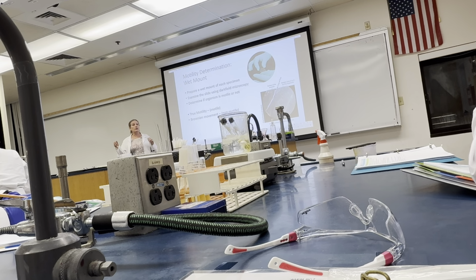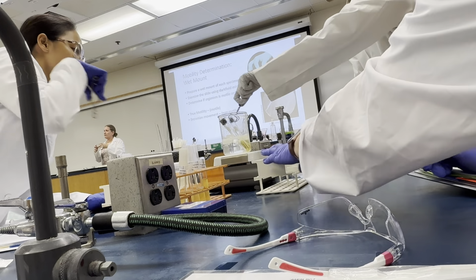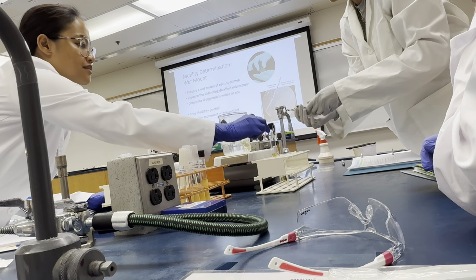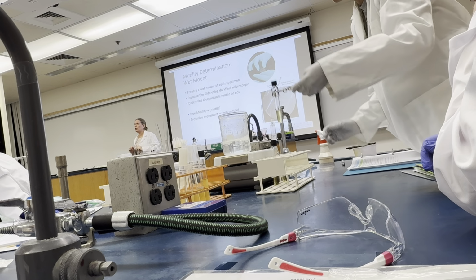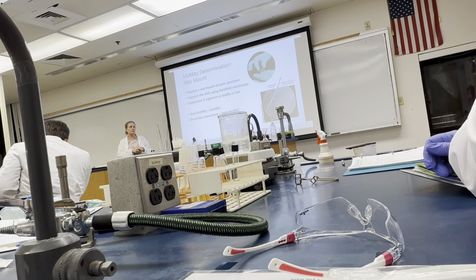And they can bump into each other. So you might see some wiggling, jiggling type of thing for Brownian motion. Or you might see currents. You have a liquid underneath that microscope, you have light, there is going to be a current as the water heats up, okay? Brownian motion is non-motile. True motility is where you see individual cells moving in different directions, doing different things. They're not moving as groups in a current, and they're not just jiggling. As you watch them, they're actually moving.